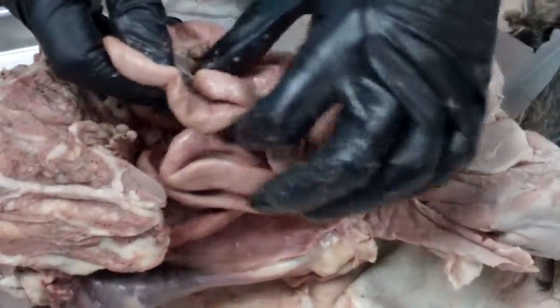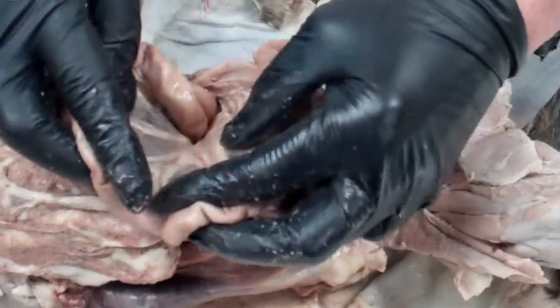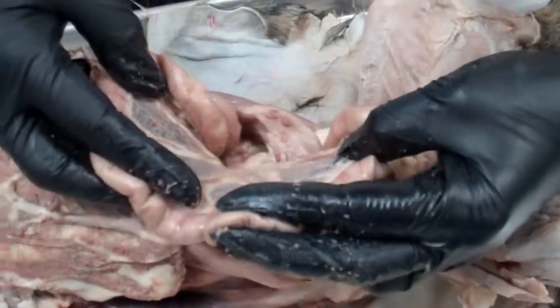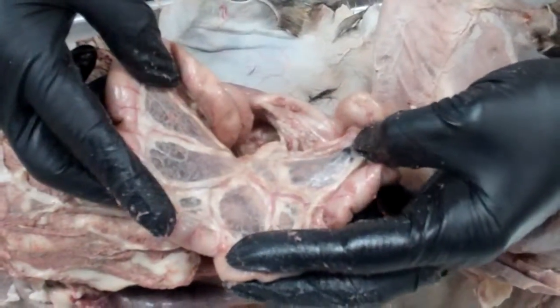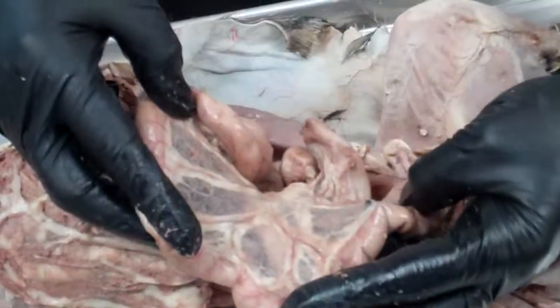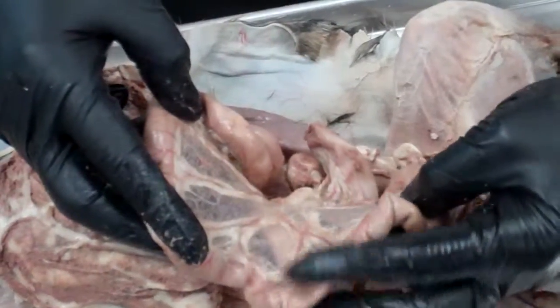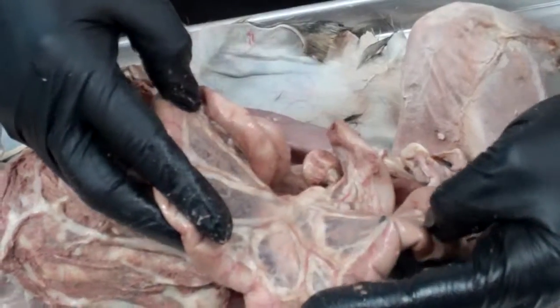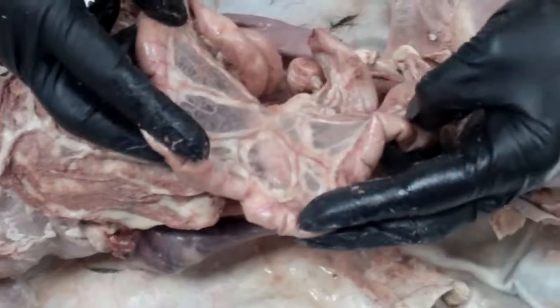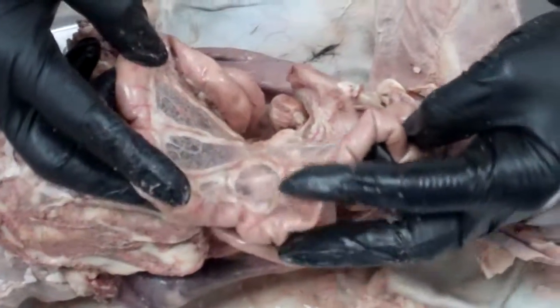And the structure in between the small intestines, this is called the mesentery, and in the mesentery you have the blood vessels. Looks like we only have the arteries filled with latex in this cat. Hopefully yours also have blue blood vessels in there. Mine are just kind of dark colored.